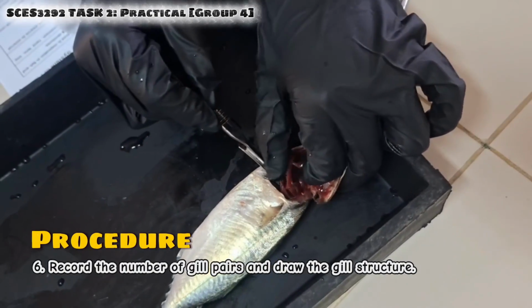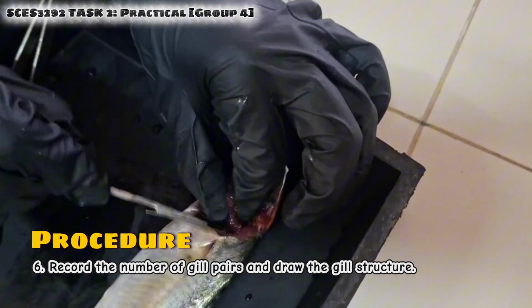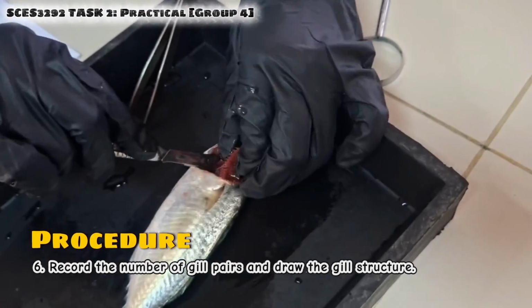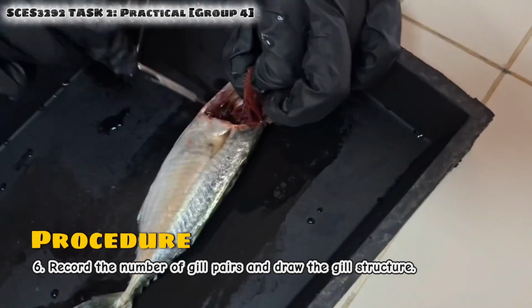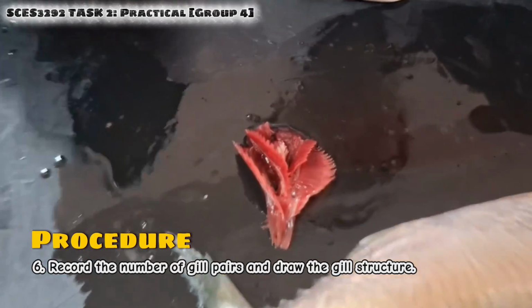Now I'm going to cut out the gills. And then I will observe the gill and draw the observation. This is the structure of the gills.